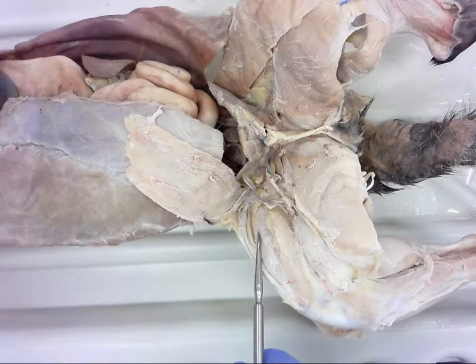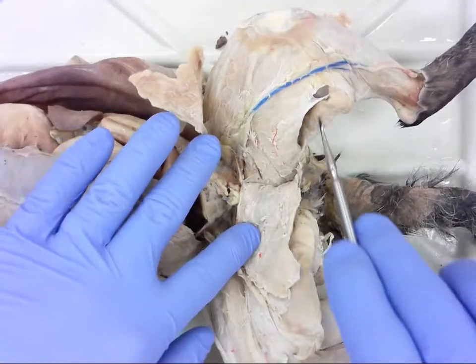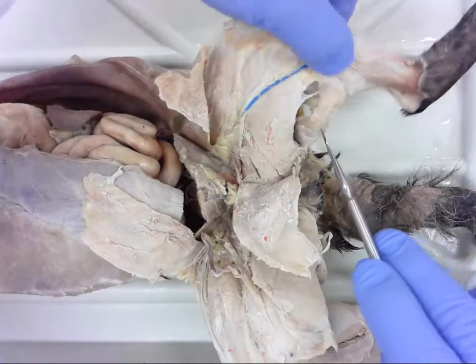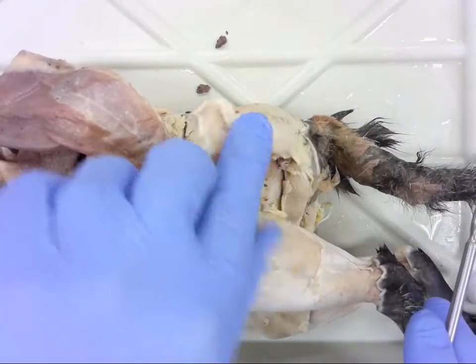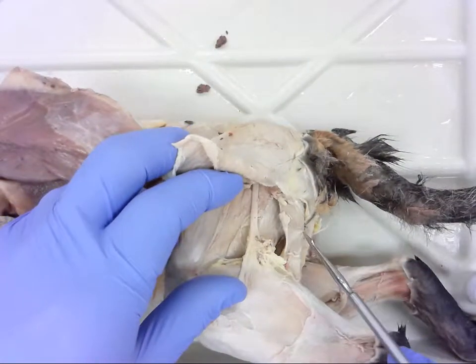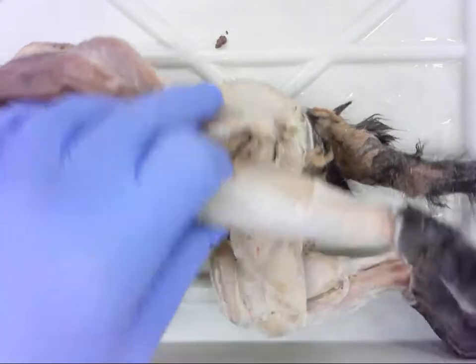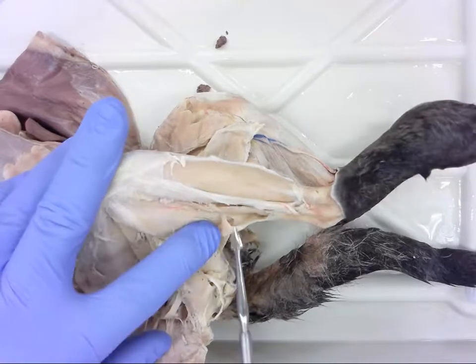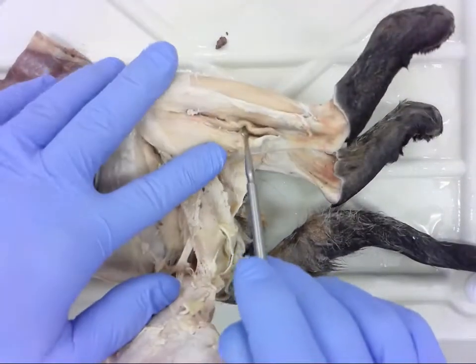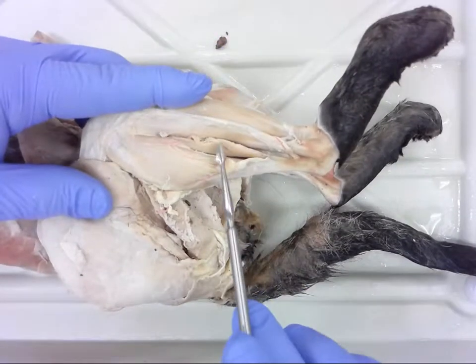Number nine — on the other side. Move these out of the way. This is number nine. Extend that a little bit; you can see it from a medial view. Flip over — you can see it from a lateral view. And number ten is going to be right here. Get some things out of the way so you can see it. This is number ten.